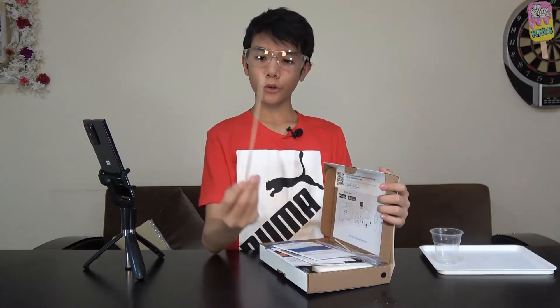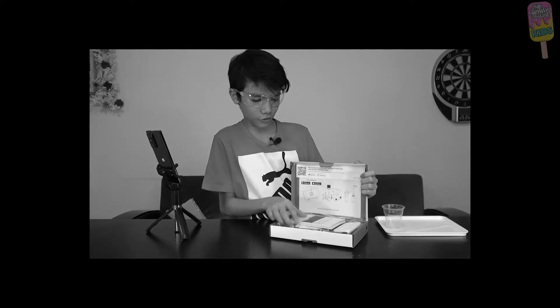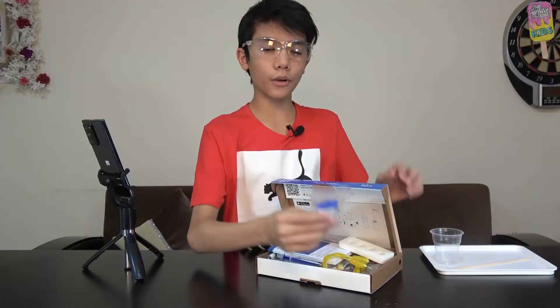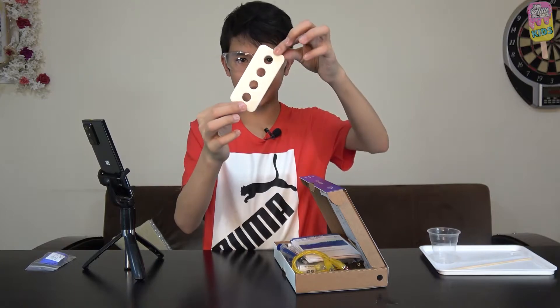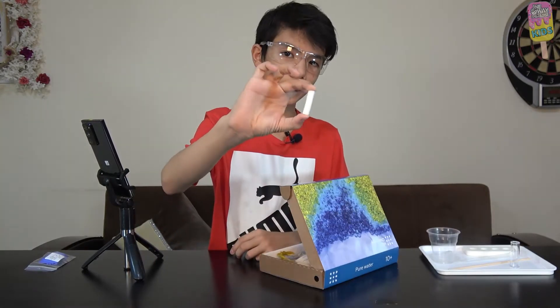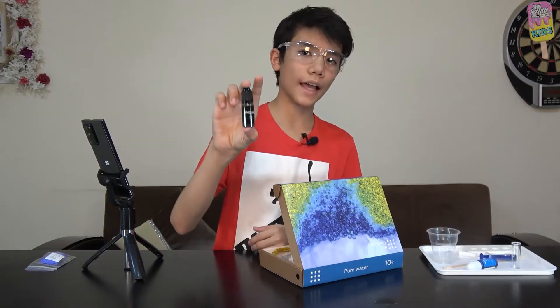We're going to want to take a wooden splint. This set is actually pretty stuffed, not going to lie. There's so many things going on: wires, candles, whatever these are called. We're going to take some gloves, a filter body, a vial stand, a pin opener, a plastic vial, a cotton cylinder, a measuring syringe, some methylene blue, and activated carbon.